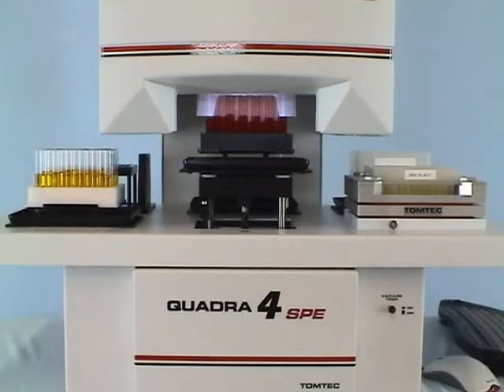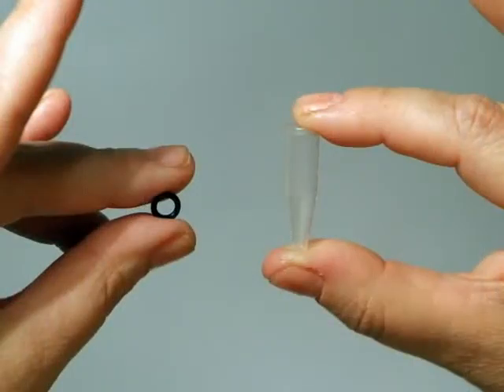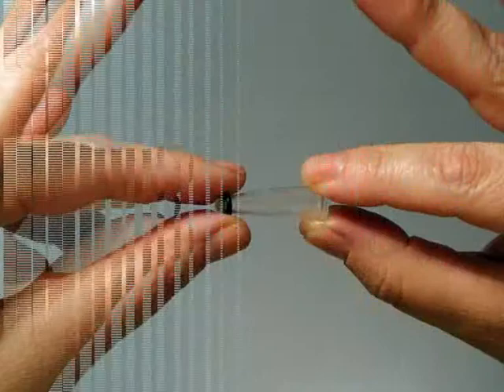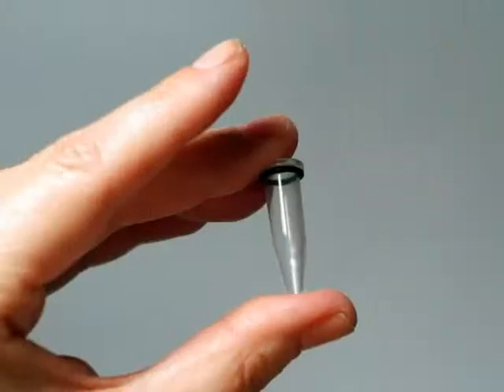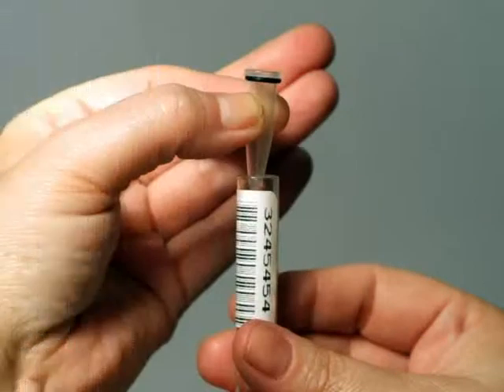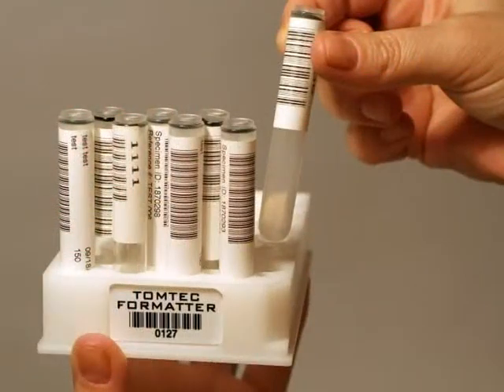The sample processing protocol is not limited to large volume liquid samples such as urine. By retaining a small conical vial in the 12 by 75 tube with an O-ring, the same barcoded assembly may now be used for small volume samples such as oral fluids. The 12 by 75 tube simply holds the barcode. The Quadra can now reformat small volumes into the 96-well format 48 at a time.